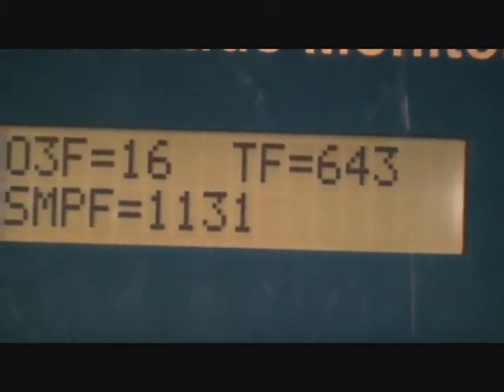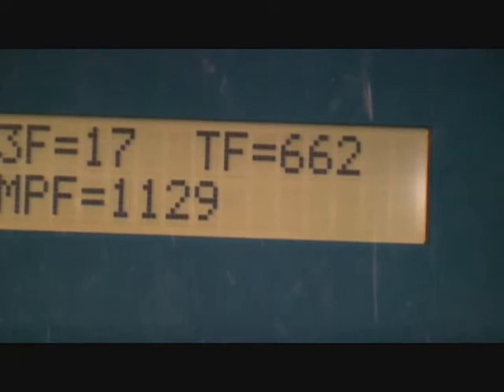It is 606, and if I turn the screw clockwise, it's going to close this valve, and it's going to increase that flow rate. So now we're at 662. What we do want is 600 when we're in this mode. This is the absolute way of setting your flow rate with the correct duty cycle.